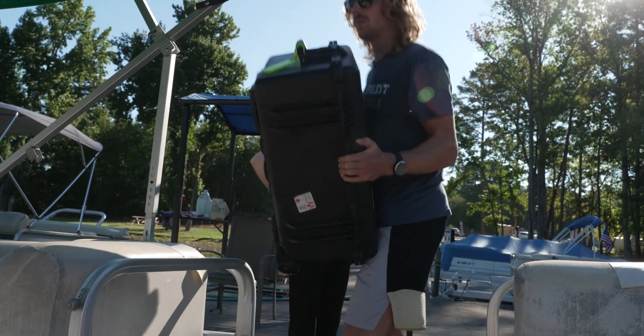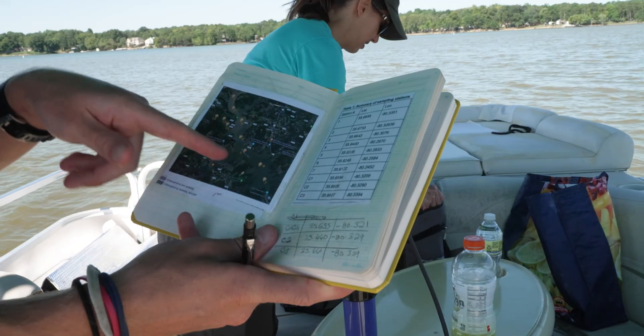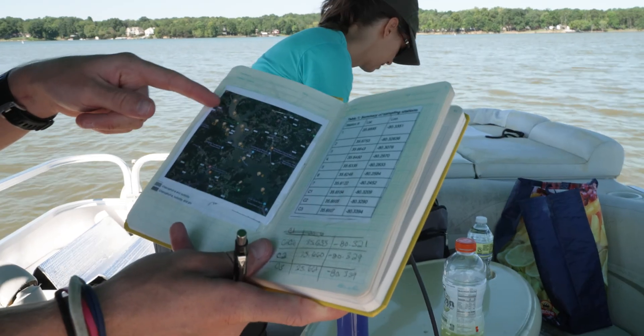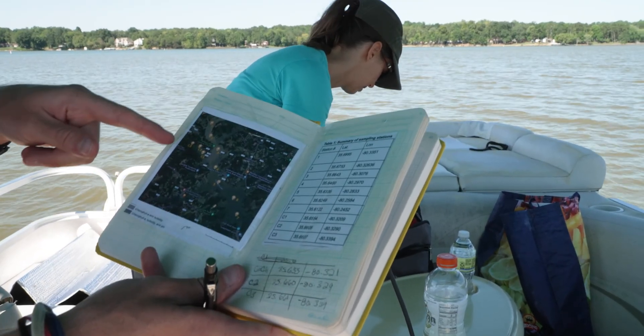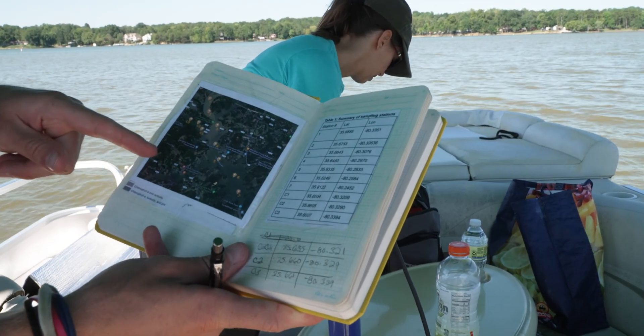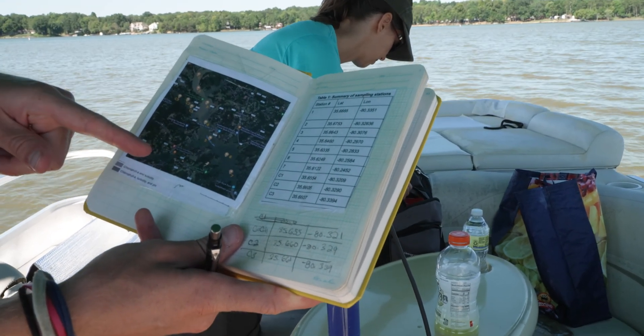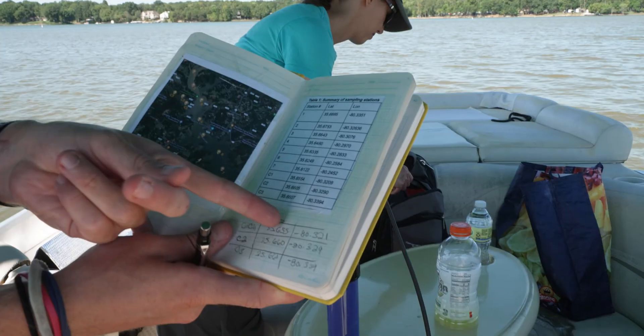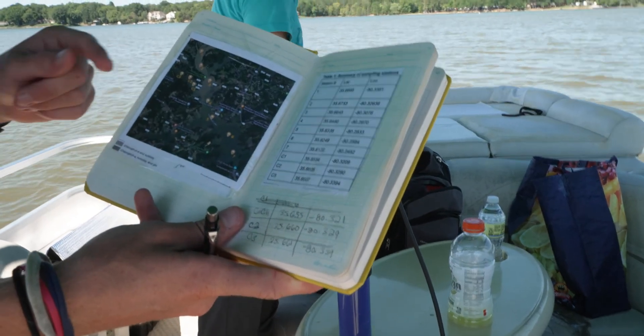This is a satellite picture of High Rock Lake, and these are all the sample points that we go to on the lake. These are the latitude and longitude coordinates.